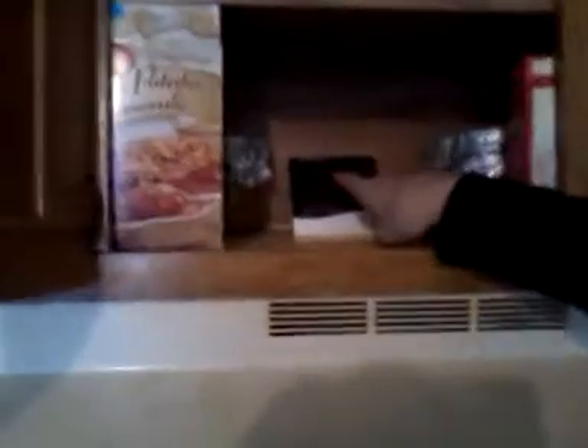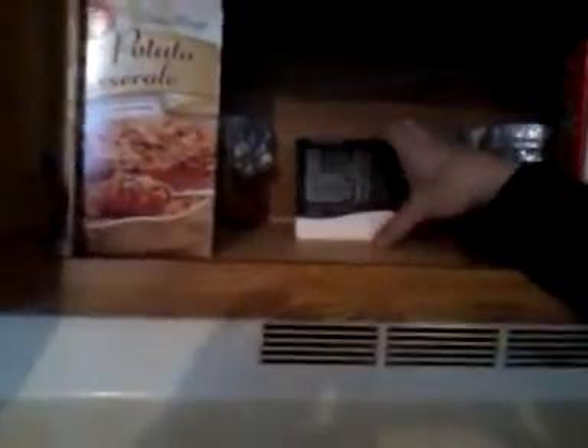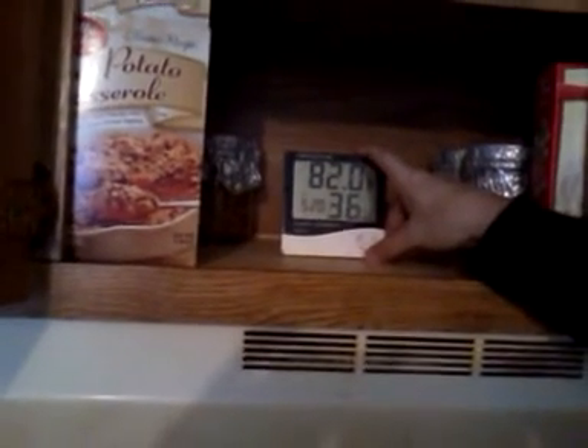They must incubate afterwards at at least 86 degrees. You can see mycelium starting to form on the popcorn. Do you see it down here? The white is the mycelium. This has only been three days, so you can barely see it, but it is already starting to grow.